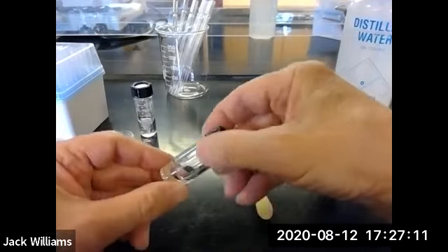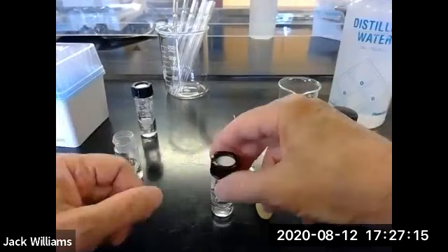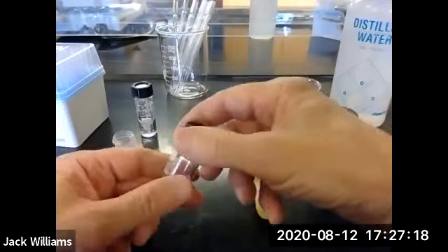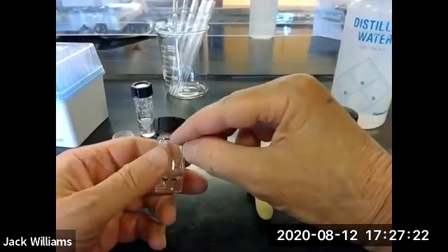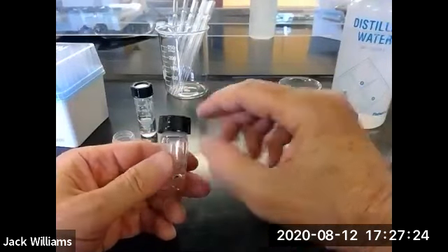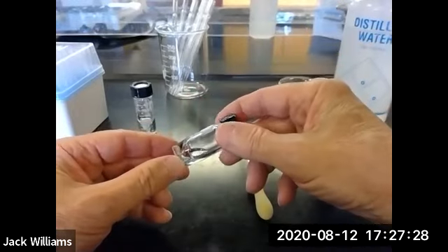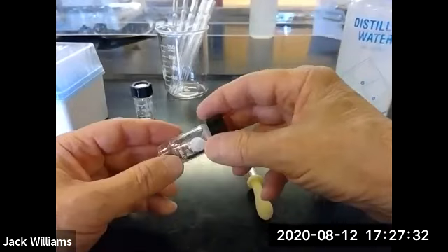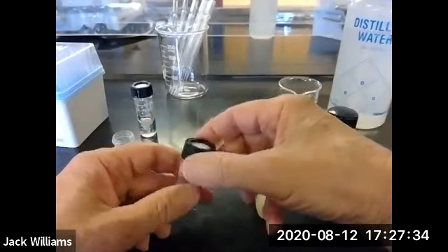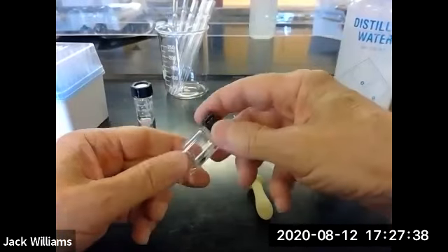I really don't have to because as long as you transfer from here, we're going to evaporate anyway, right? But as this evaporates, it actually cools down. You can feel it's getting cool. And it'll cause moisture present in the air to condense. You'll end up with water in your benzoic acid, and then you're going to get the wrong distribution coefficient, right? Because you're going to be weighing benzoic acid and water. So cap it as quickly as possible. I can feel it's already cool, so some of it has evaporated.